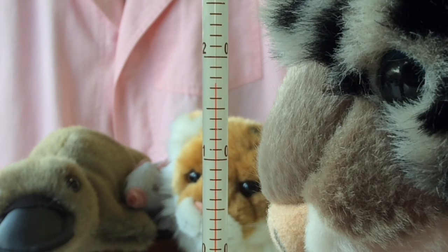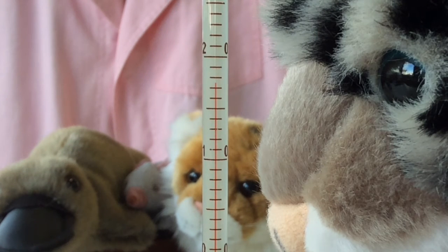So that's the 3 reactions done. You'll need to answer the rest of the questions and put a conclusion. Now, don't worry about an evaluation because I did the experiment. You can type it up if you like, except there are calculations and I need to see all your working out. So I'd say it's going to be easier to handwrite it because you've got those energy calculations. It would be a good idea to get this experiment completed and written up before the SAC, because it will contain similar calculations.